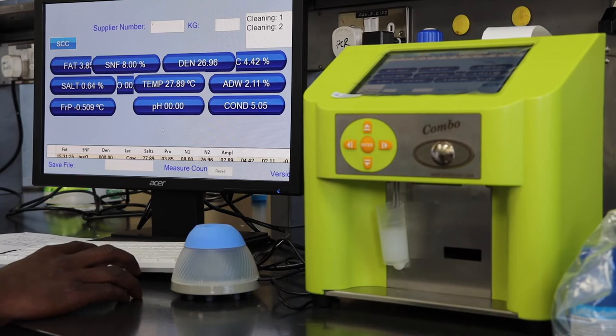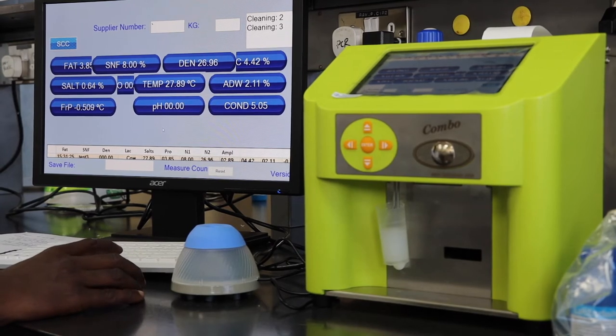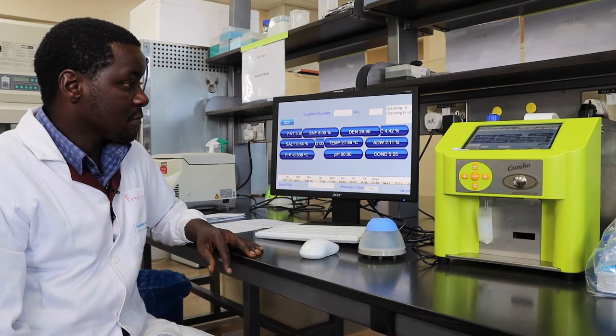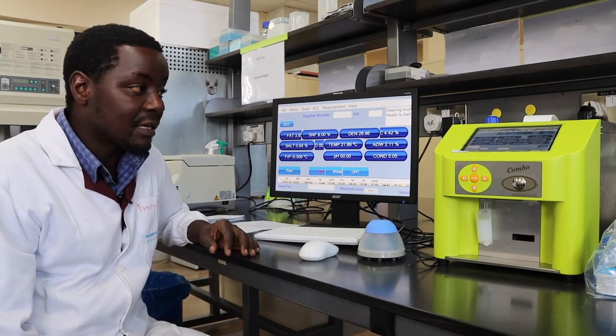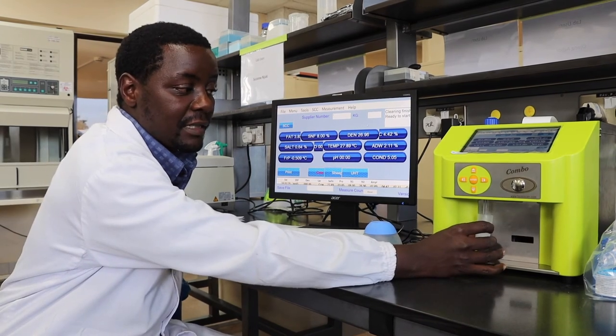Once the cleaning is done, the instrument is ready for the next analysis. Once the cleaning is over, you'll hear a beeping sound. Now you're ready to perform the next analysis.